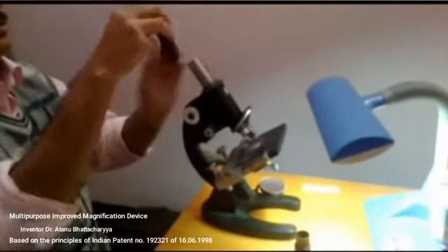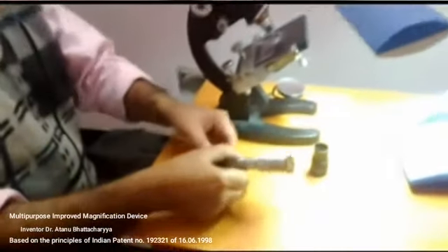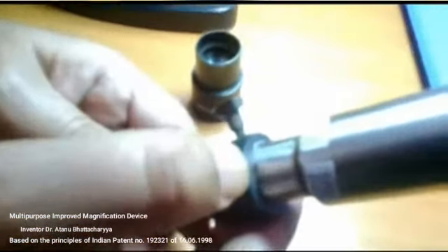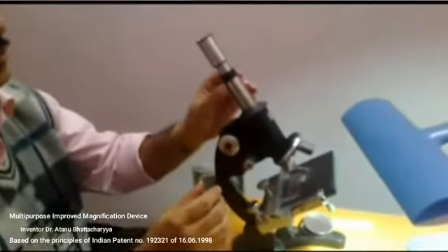Now there are graduation marks to understand the magnification. Look at the device. Here it is written 4x, and here is written 3. That means if I push the T1 tube into the T2 tube and just the number 3 touches the end margin of the T2 tube, and if we use here a 4x objective of the microscope, then 30 times magnification can be achieved. That means by using the 4x objective of the microscope, and after the 3 graduation mark the tube has been pushed, so after using the device on the microscope, 30 times magnification can be achieved.